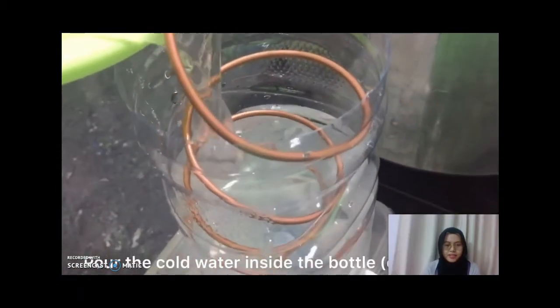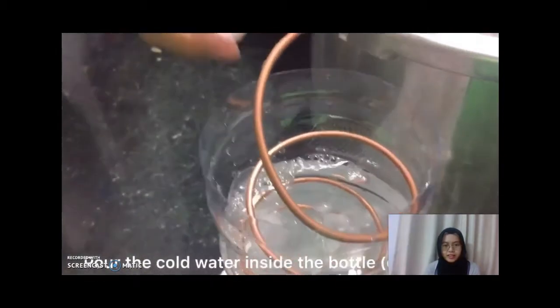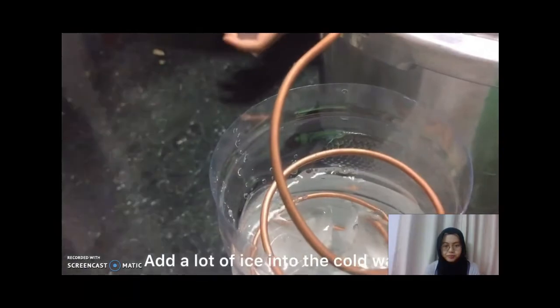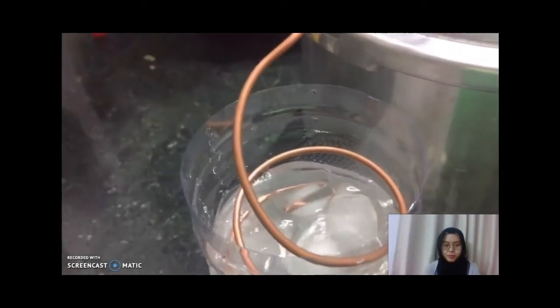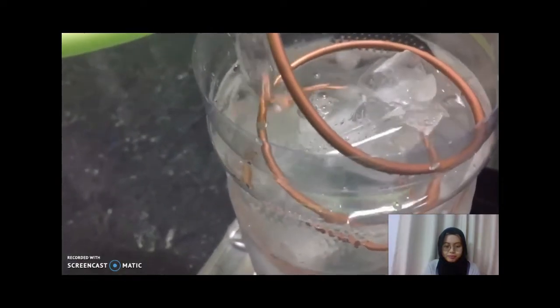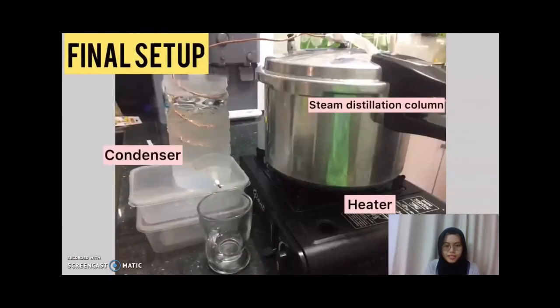Okay, the last step is to pour ice and cool water inside the condenser. Put a lot of ice. So this is the final setup.